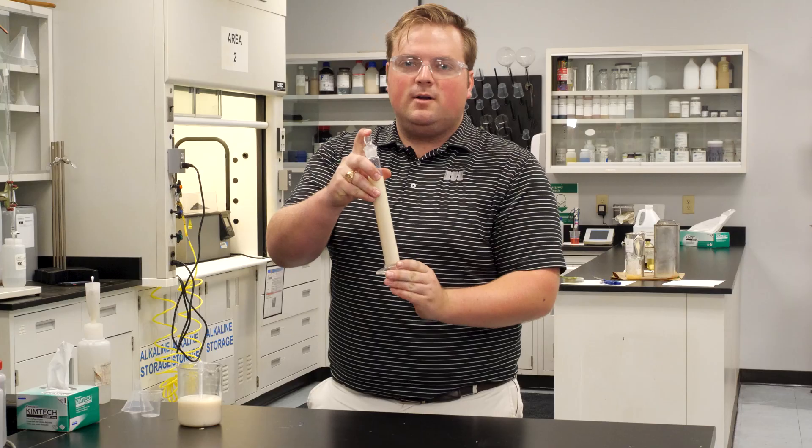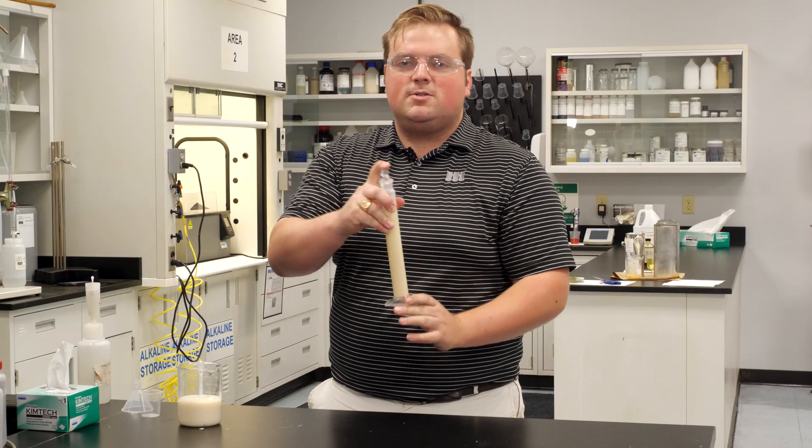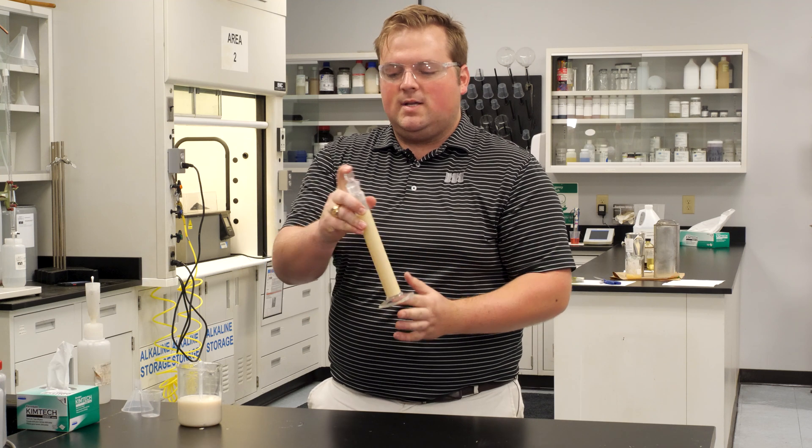Then you're going to use the stopper, place it on top of the cylinder, and invert it several times to make sure the acid is thoroughly mixed within the solution.